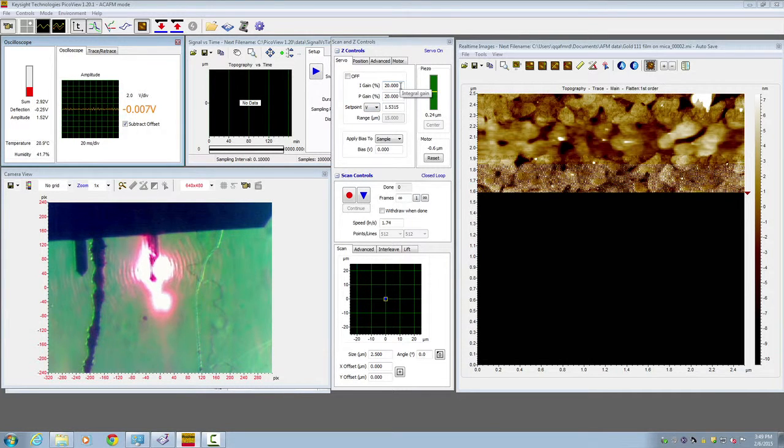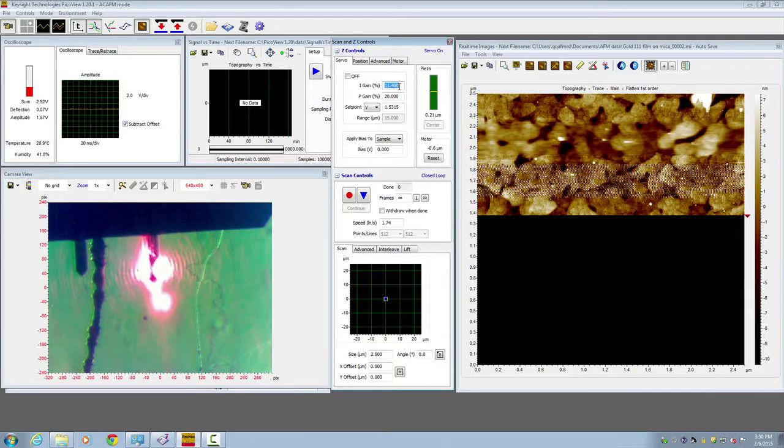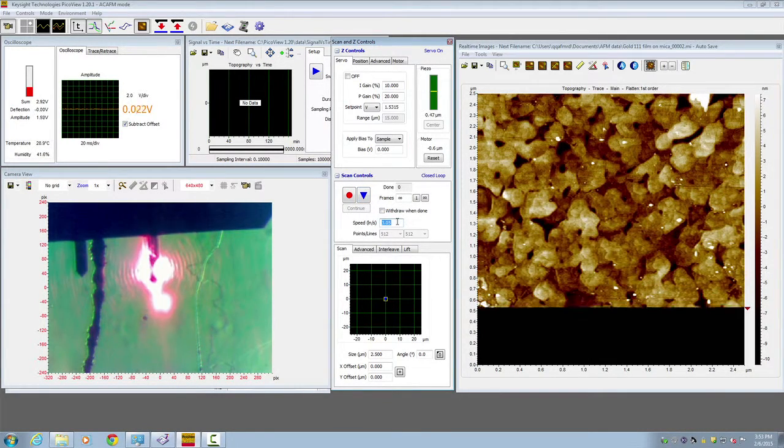So we go back to the servo control and start to reduce the I gain. At the same time, look at the image and look at the oscilloscope. As we notice, when the gain is reduced back to 11%, the image appears to be clean and the noise is gone. To ensure extra stability, we could reduce the gain another 1%, going down to 10%. Now, once we are sure about our parameters, we could click this button and restart the image, so we can capture the entire image in high quality.